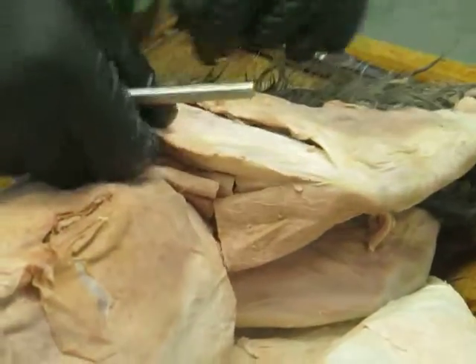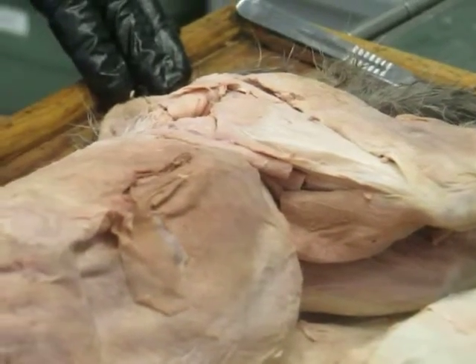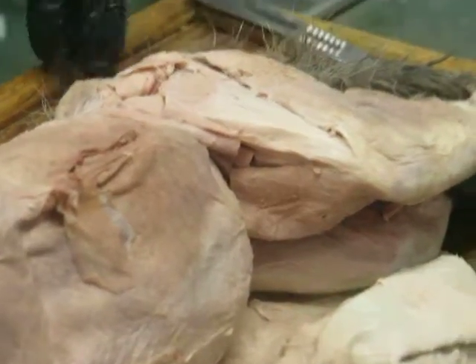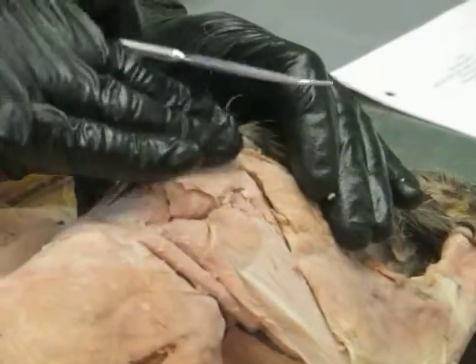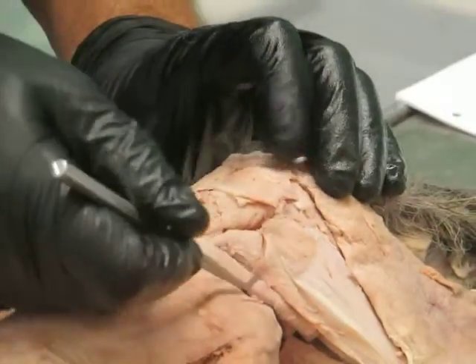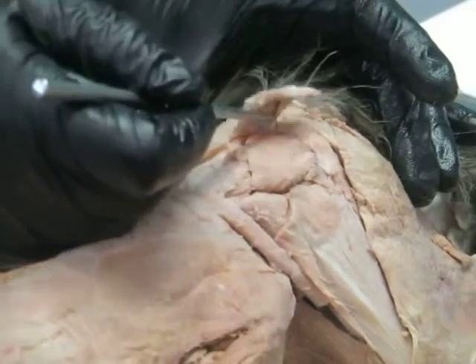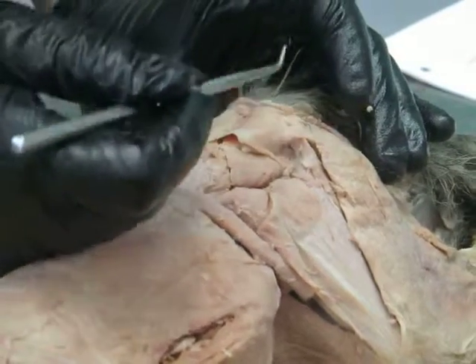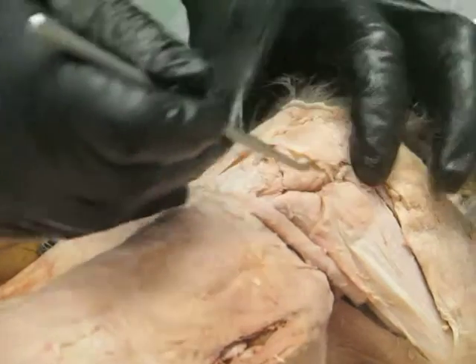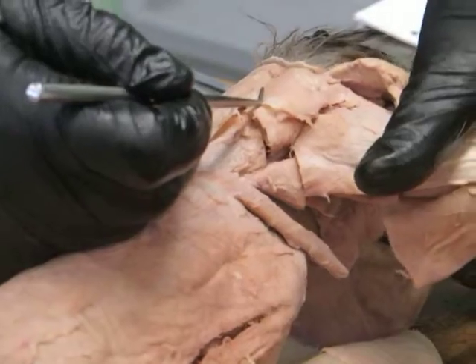Okay. As long as we're here, let's just continue with the gluteal group, because technically the tensor fascia latae is part of the gluteal group of muscles. Okay, so the butt muscles. And they all kind of come over the top of the hip here. And right behind tensor fascia latae is this one. It's also kind of superficial. I've sort of removed it from its insertion, but that would be gluteus superficialis. Okay. And this is also basically an abductor of the hip.